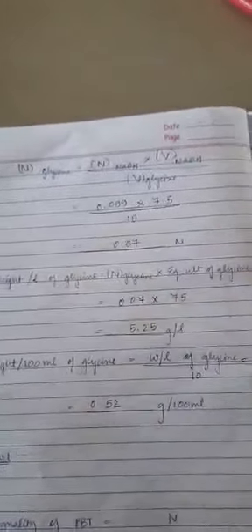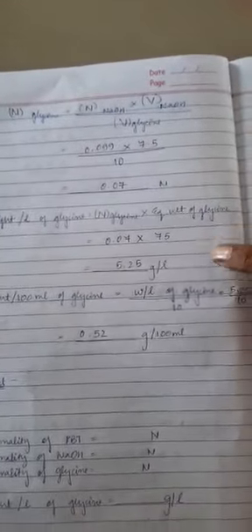Okay, and you can go for the calculation of normality of glycine. Fine. So the normality of NaOH, how much had you got? 0.099 into the volume of NaOH consumed, how much? It is 7.5, divided by the volume of glycine taken, it is 10 ml. Yes, further you can go for the normality weight per liter. Use the equivalent weight of 75 and calculate it for gram per liter and gram per 100 ml, and you can report your further readings.